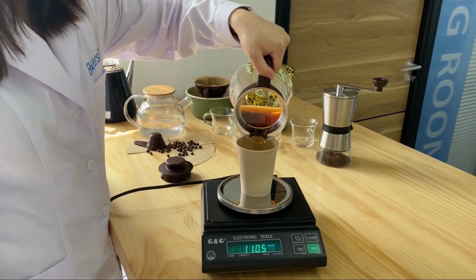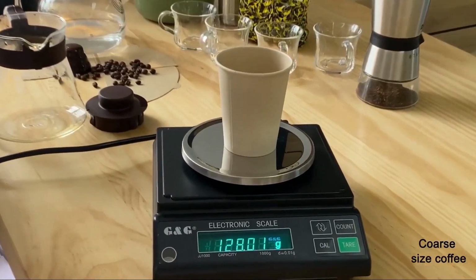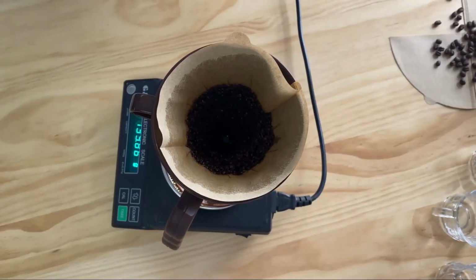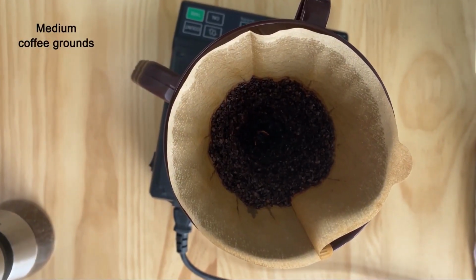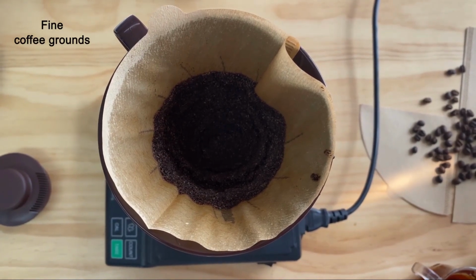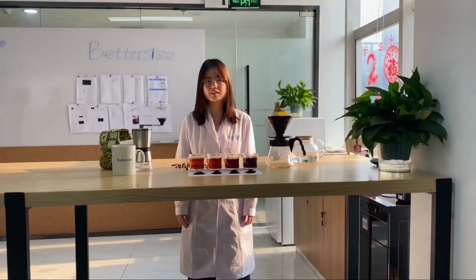Next, we will weigh the brewed coffee to compare the extraction level of each grind. We can see that the coarse size produced the most brewed coffee, while the extra fine size produced the least. After brewing, the leftover coffee grounds look different. The coarse and medium coffee particles are still distinguishably separated from each other. In contrast, the fine and extra fine particles aggregate and tend to move to the bottom part of the filter.